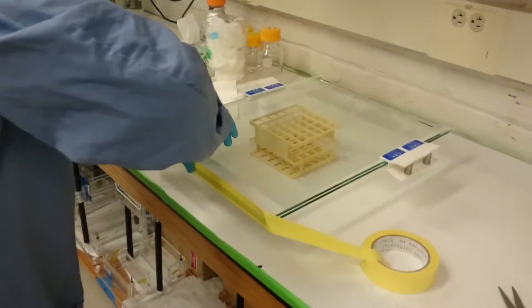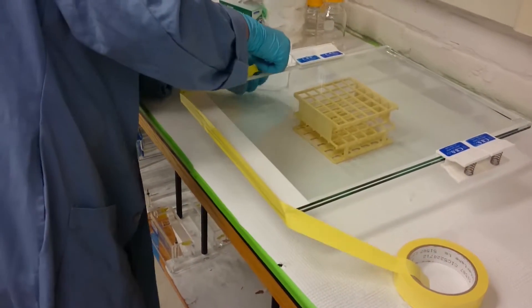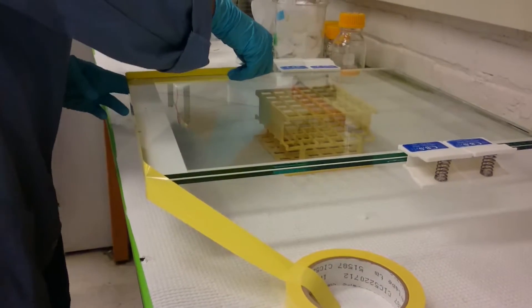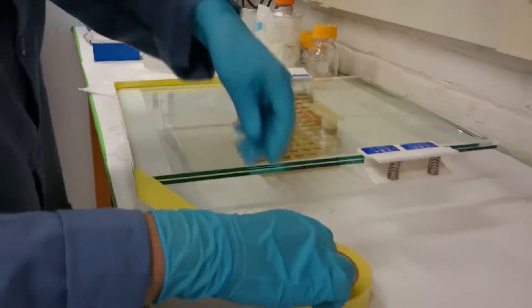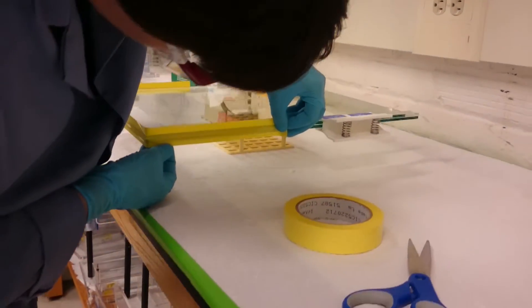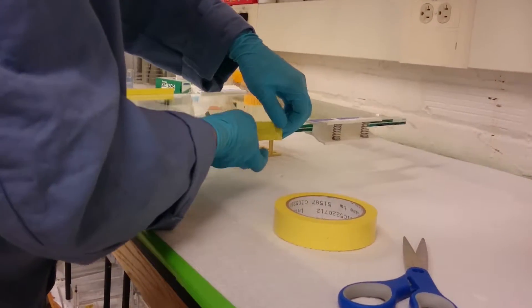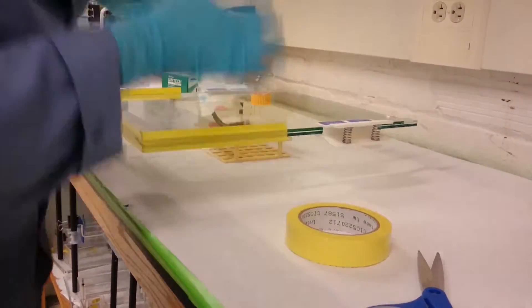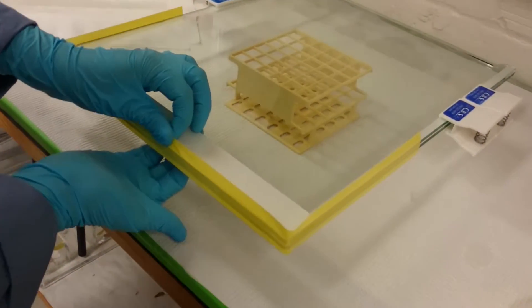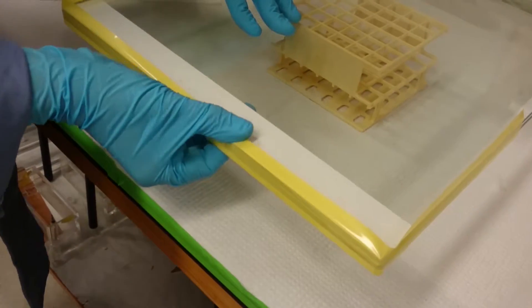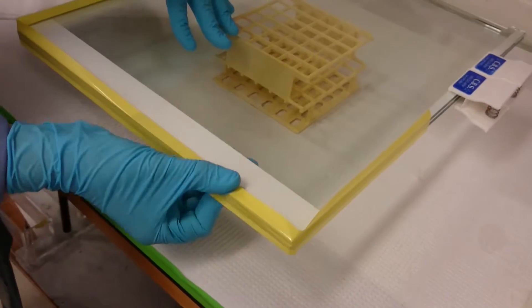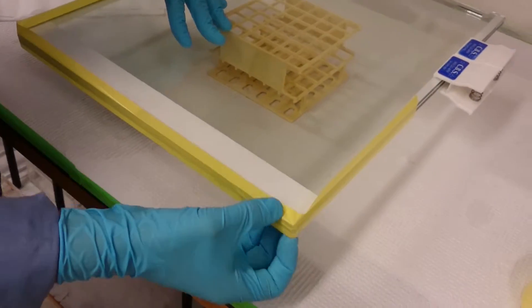Okay, and then we can seal it along the bottom. And I'm going to seal it up the side now, trying to keep that same 70 to 30 ratio. Got it lying flat on there. Same thing on this side. Okay, and now we need to get it folded over the top and bottom with as few wrinkles as possible. So I start in the middle, and then the best way to avoid wrinkles is to go side by side and press it toward the part that's already sealed. You can see how I'm doing that.